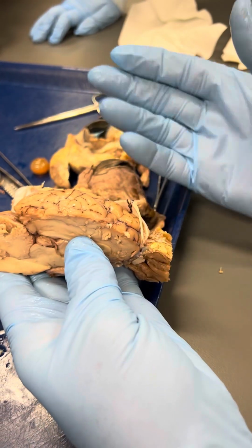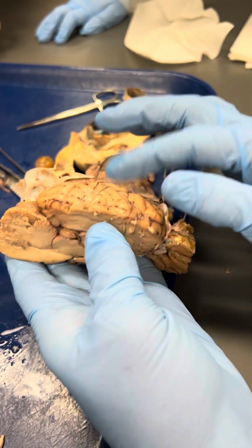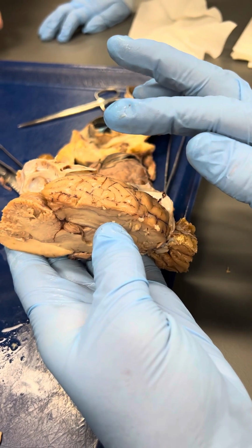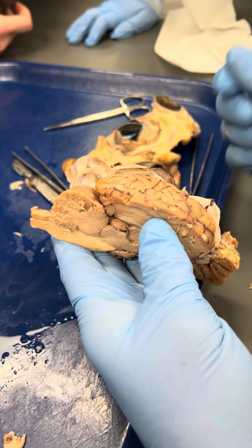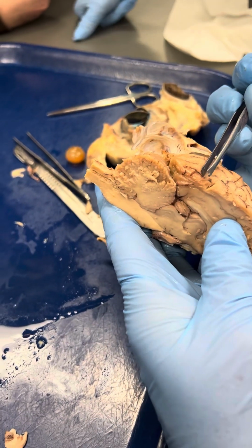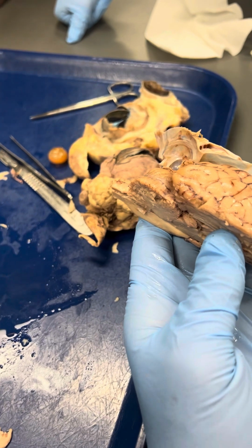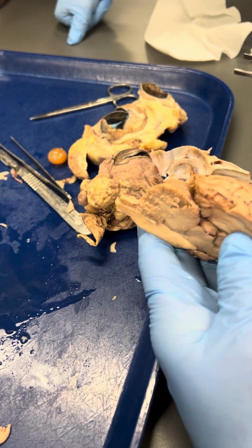The pia mater, one of the meninges, it's not neural, it's just a protective tissue, but it's intimately associated with all the curves, the fissures, the gyri that you see on the surface of the brain. So you can't peel away the pia from anything, but where you see these little blood vessels, these little brown lines, most of those are blood vessels, those would be embedded in the pia mater, and then they start to branch off into capillaries inside the brain, small vessels.